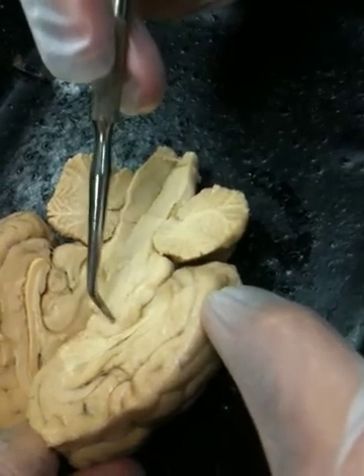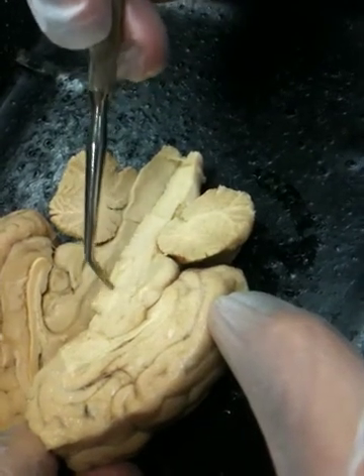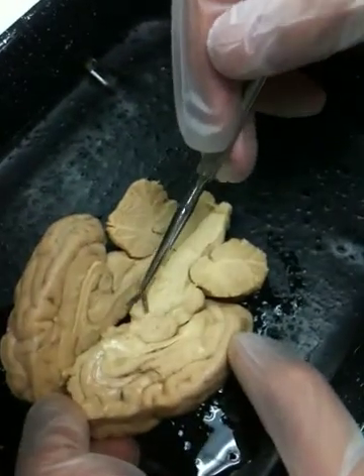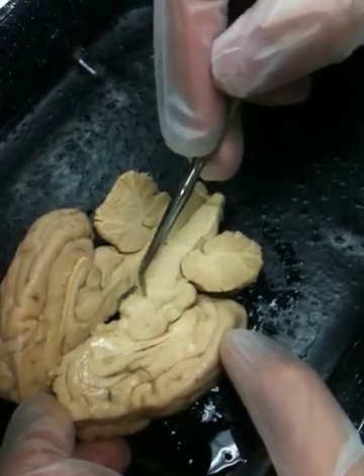Hypothalamus. Hypo means below, so when we look for the hypothalamus below the thalamus, it's this region right in here, between this enlargement here and this mammillary body back here, which we identified previously. This other area, kind of grayish in here, would be the hypothalamus.